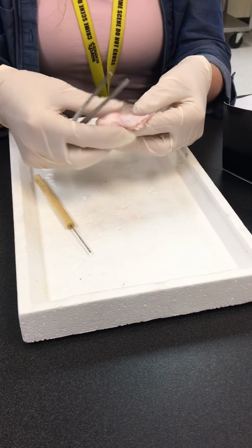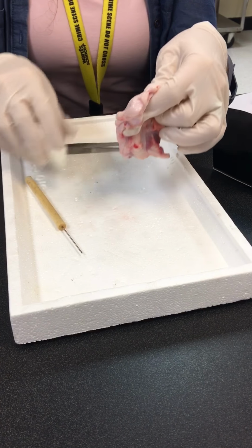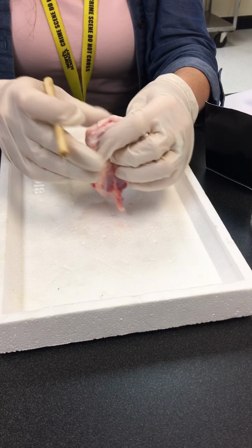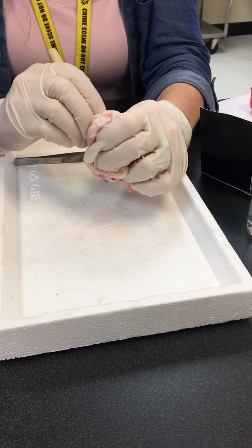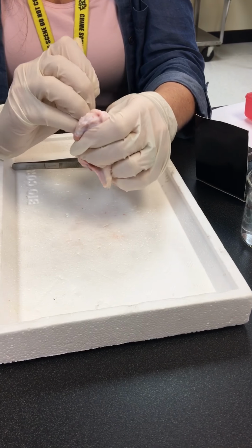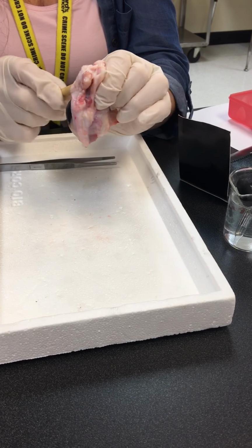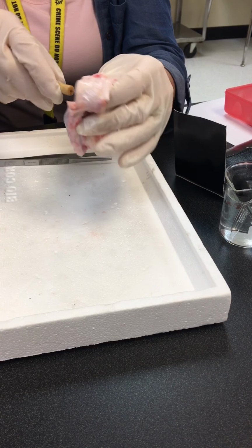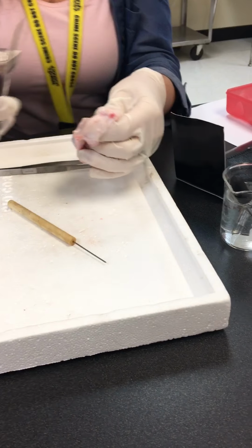So what we're going to do, because we don't need all this extra material over here, is cut away. And this is very tough, because this is very fresh, and I can hardly poke this through here. It's so tough. I'm just gonna use scissors. I wanted to get a puncture started so I can do this.